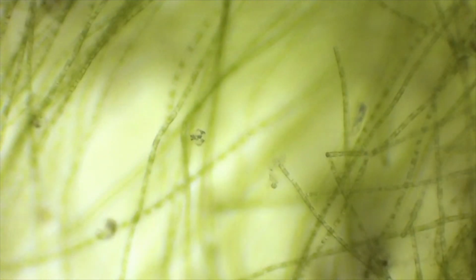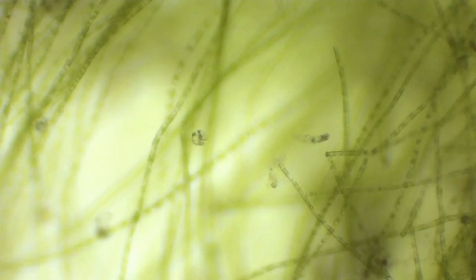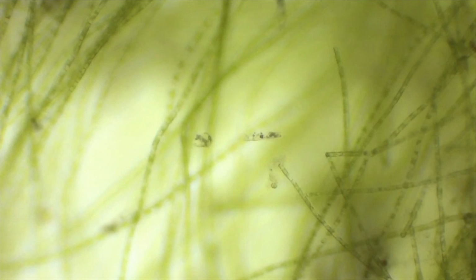The Paramecium were the most abundant microorganism I encountered in this sample. However, during the time I spent attempting to classify them, I noticed in comparison to other recordings of the P. caudatum, my specimen tend to move in circular twisting motions rather than the expected long linear strides. I assumed this could be due to the copious amounts of algae surrounding them, which would cause a limitation in their movements.